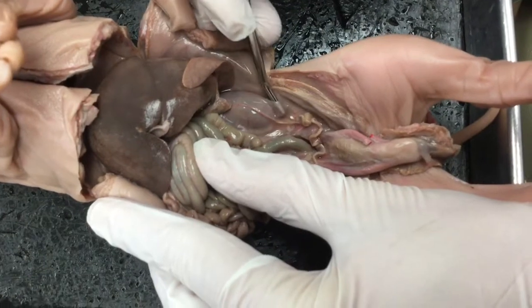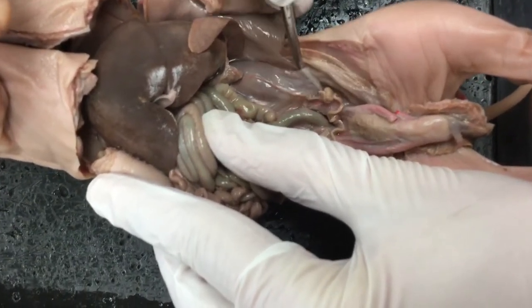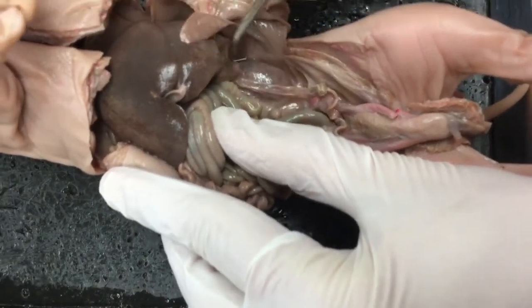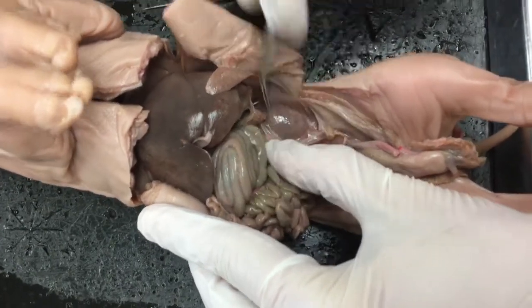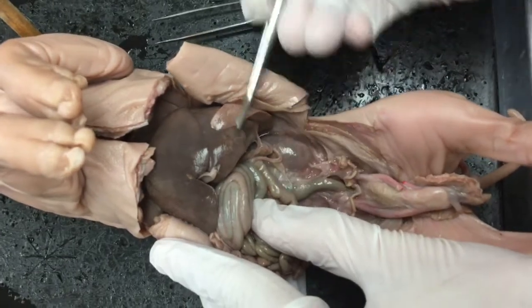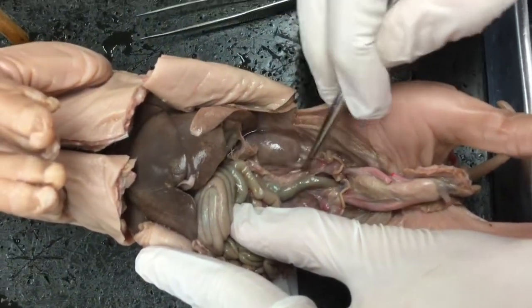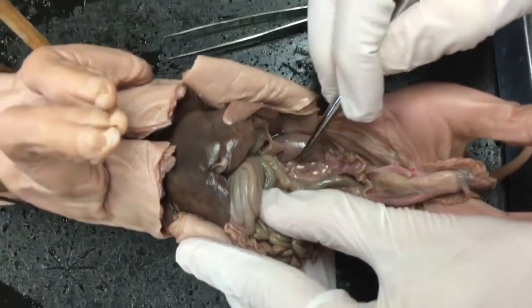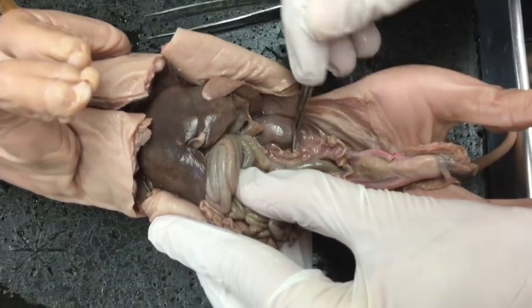film on it. And remember, we said that every cavity in the body is separated by some kind of a mucosal lining, basically. So when I pull that back, I don't know if you can see what I'm doing, but I hope so. I'm kind of poking it with my pointer, and I'm moving that film back that's housing the kidney, and I'm doing so because I can pull out the ureter.